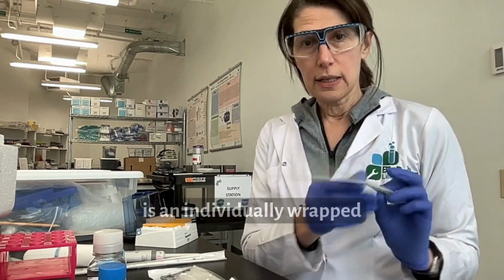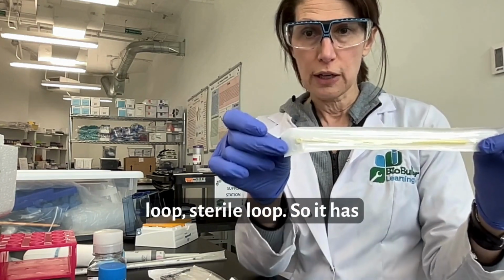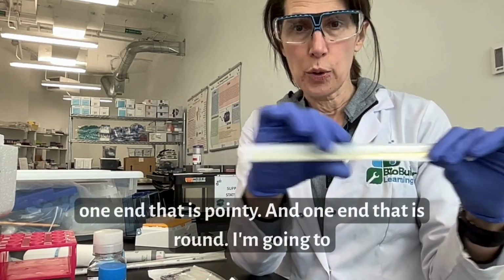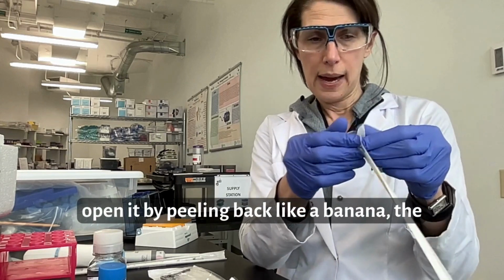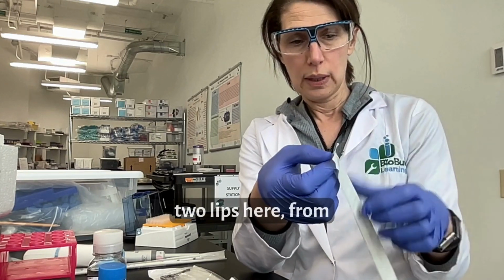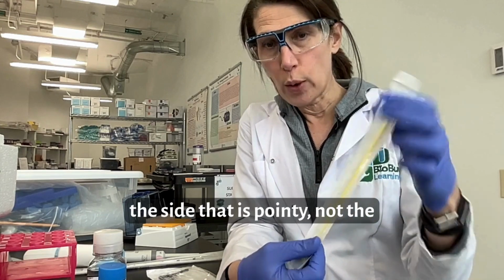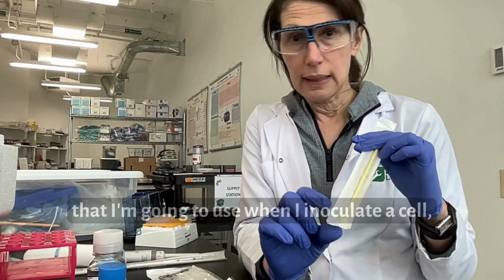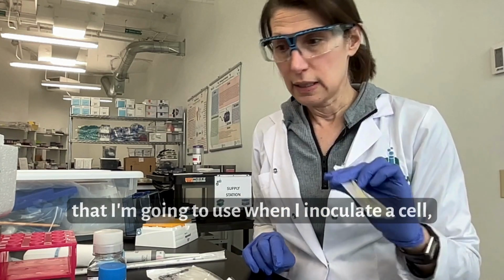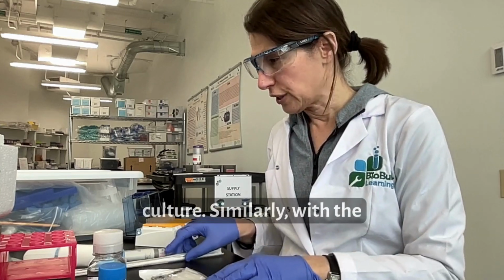So this is an individually wrapped, sterile loop. It has one end that is pointy and one end that is round. I'm going to open it by peeling back, like a banana, the two lips here, from the side that is pointy, not the side that is round, because the side that is round is the side that I'm going to use when I inoculate a colony into a liquid overnight culture.